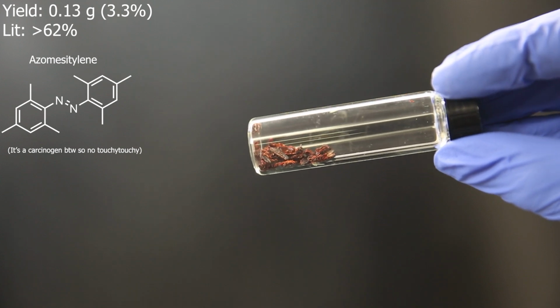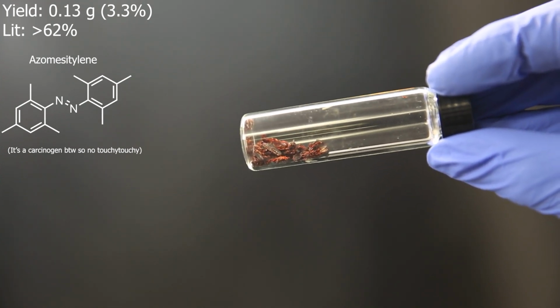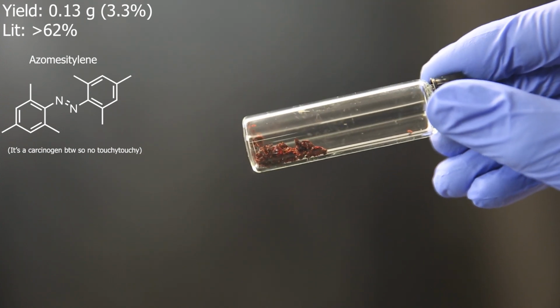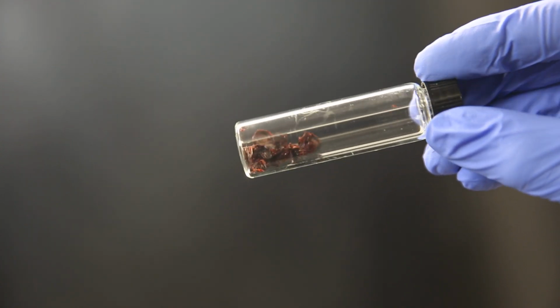Since the reaction required oxygen, it would probably be best to supply pure oxygen instead of air, since the CO2 in air can react with amines to form carbamates, which can go do other funky stuff. And as we have seen, the reaction is fairly sensitive to the purity of the amine.